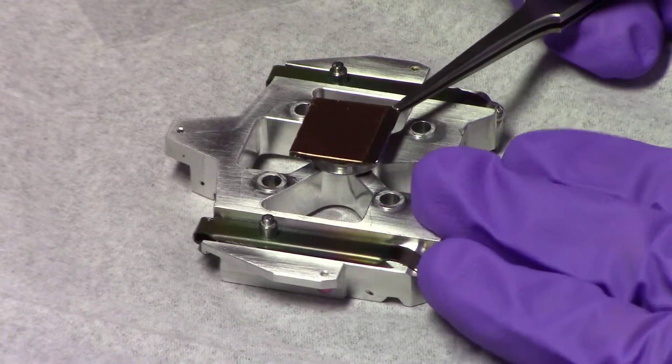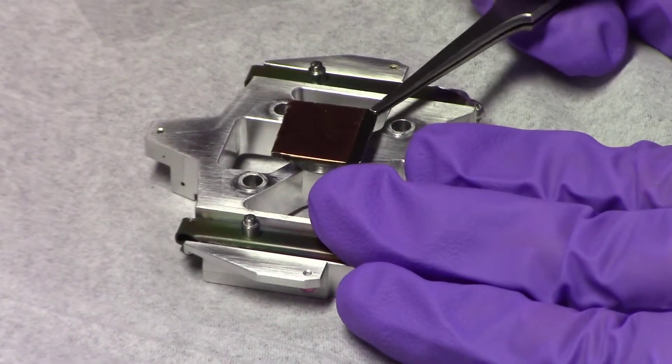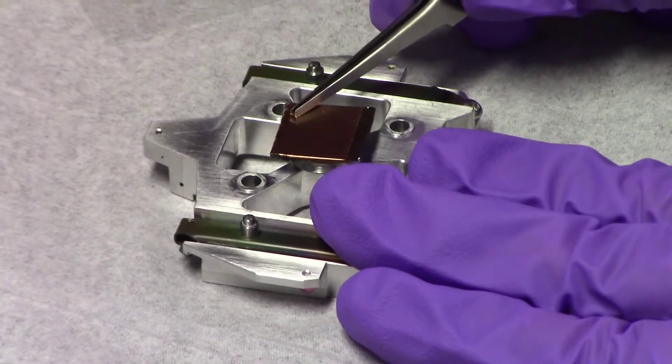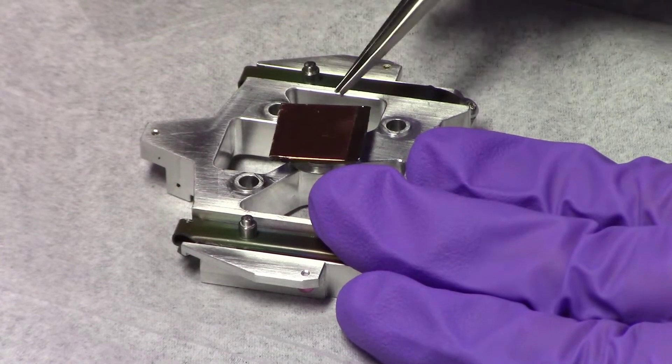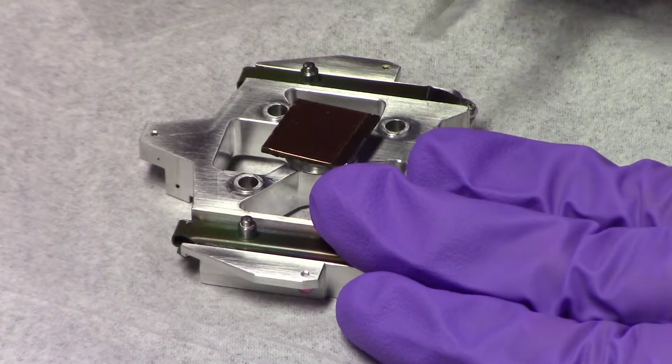Next, place your sample on the adhesive and gently press into place. For best results, it is recommended to pre-mount your samples ahead of time to allow the adhesive to fully set.